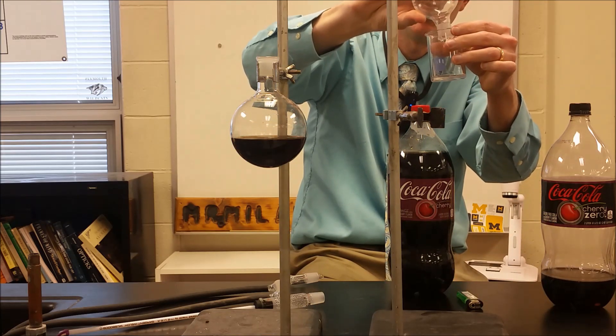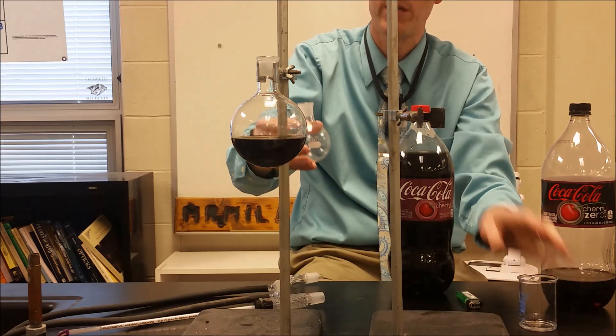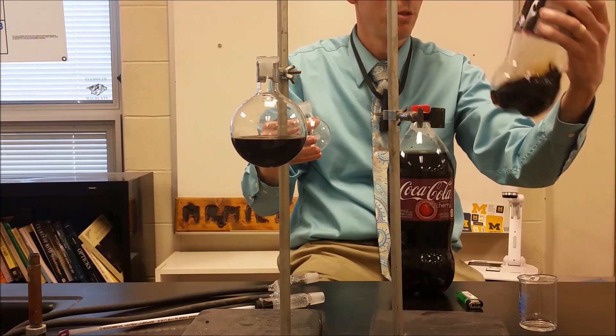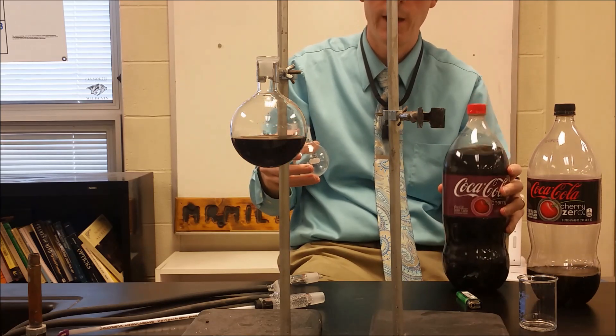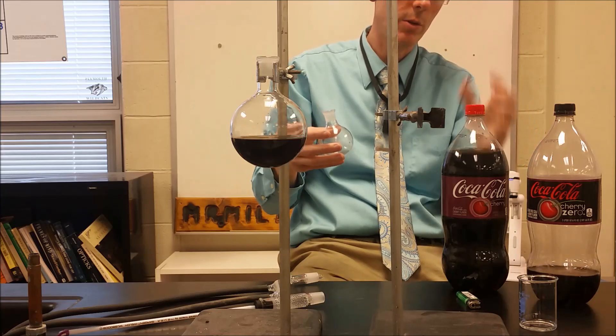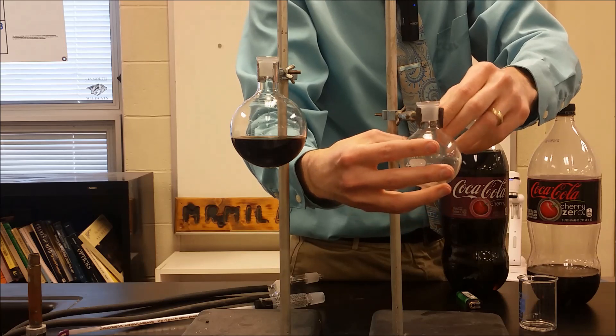So I'm going to pour that into here and then we're going to redo this experiment, but this time we're going to replace the Coke Cherry Zero with actual cherry Coke and see if we get a stronger scent or more of that scent and look at how the distillation looks in action to give some comparison.